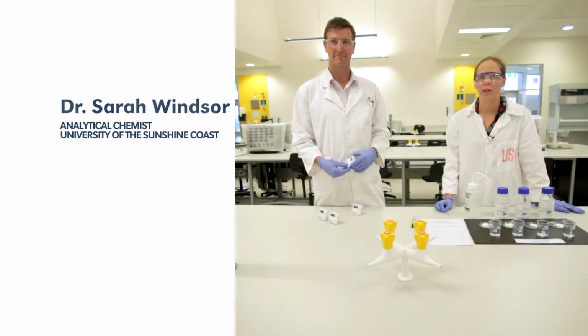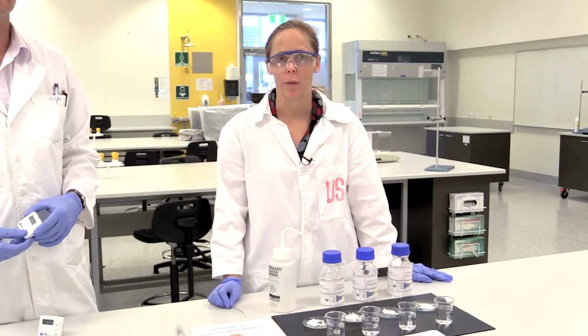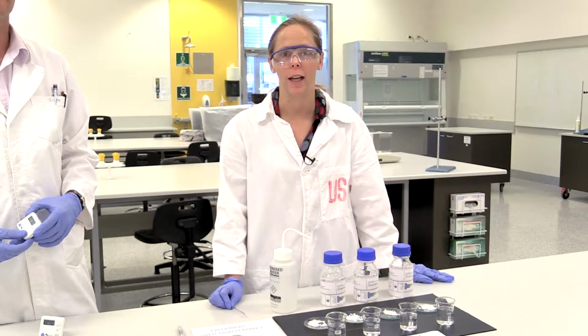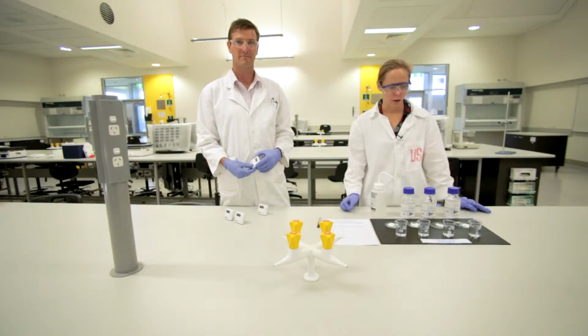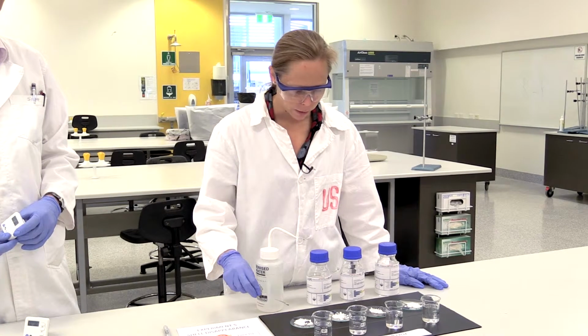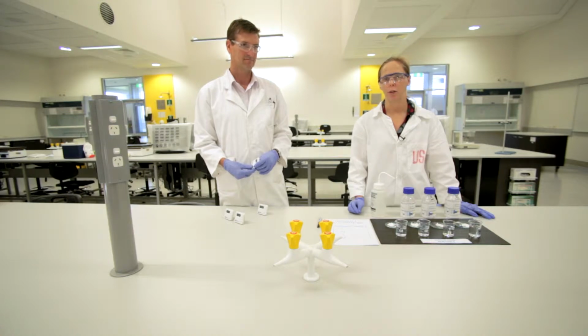So you saw in our ocean acidification example that putting the carbon dioxide into the water formed carbonic acid and turned our bromothymol blue indicator yellow. So what we're now going to look at is a consequence of ocean acidification. What happens to those creatures in our oceans that have shells? What we've got here is some calcium carbonate, and that's basically what most shells are formed out of.